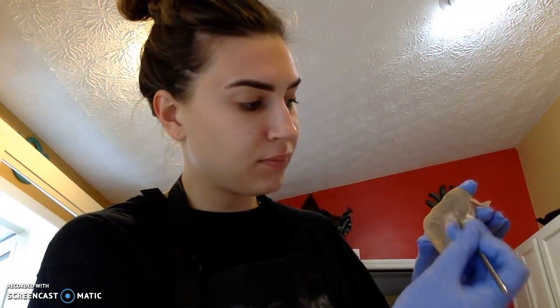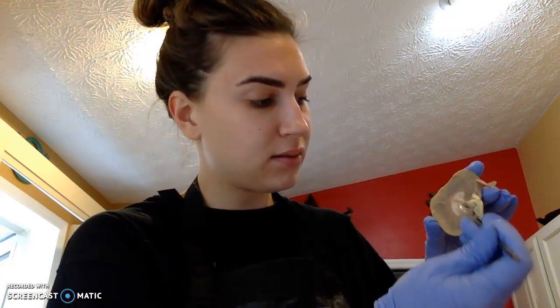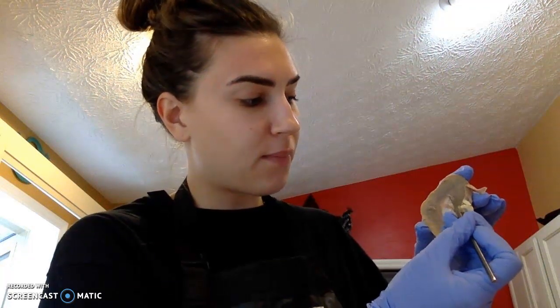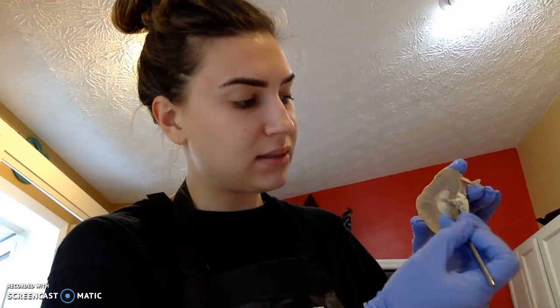So again, the identification I showed you were the renal cortex, just deep to the renal capsule, our renal medulla, just deep to the renal cortex, renal pyramids within the renal medulla. Dividing the renal pyramids are going to be our renal columns in between the renal pyramids. Then we're going to have our renal pelvis. We're going to have 4 to 5 minor calyxes that merge to form our major calyxes.